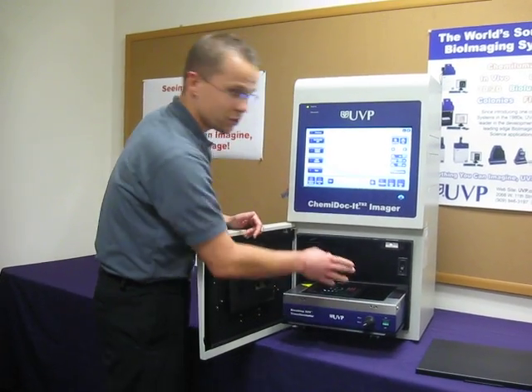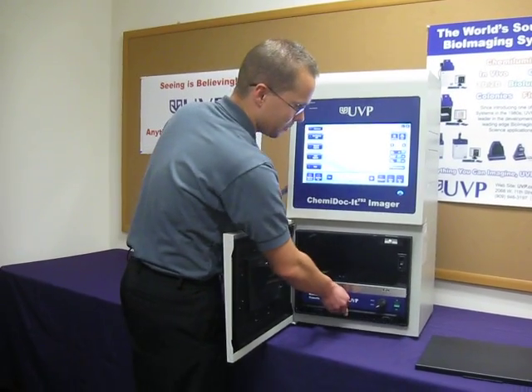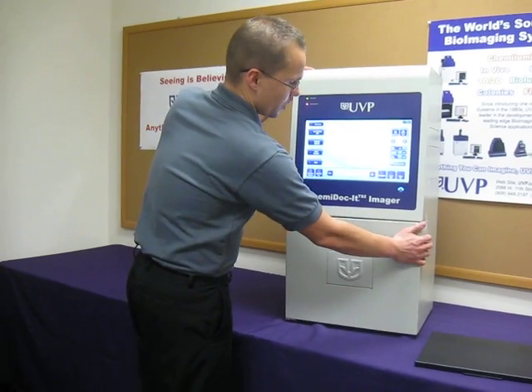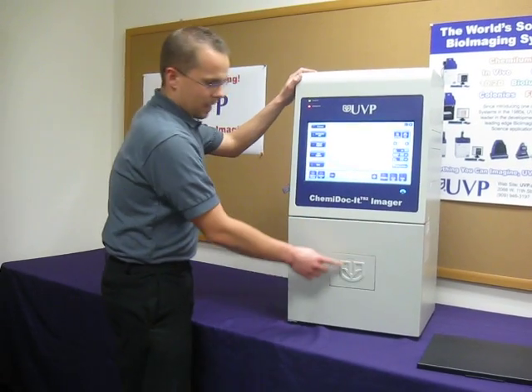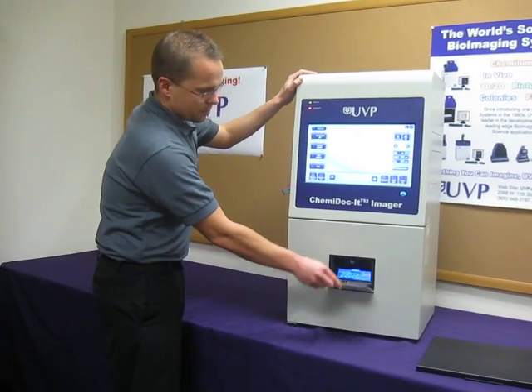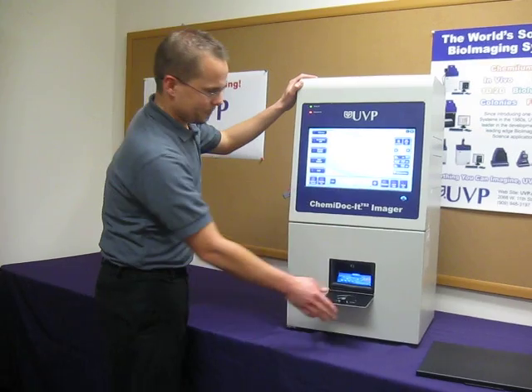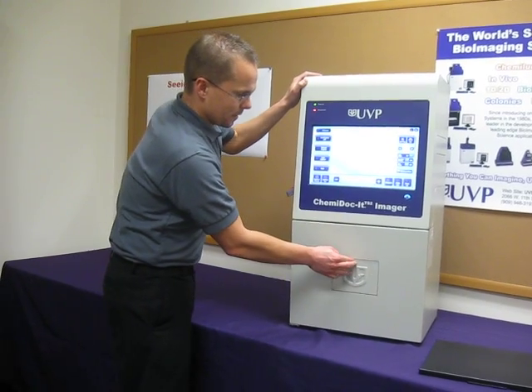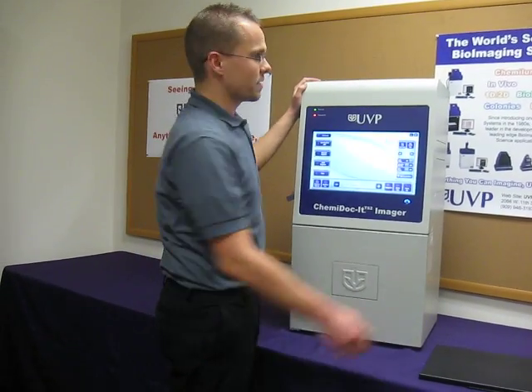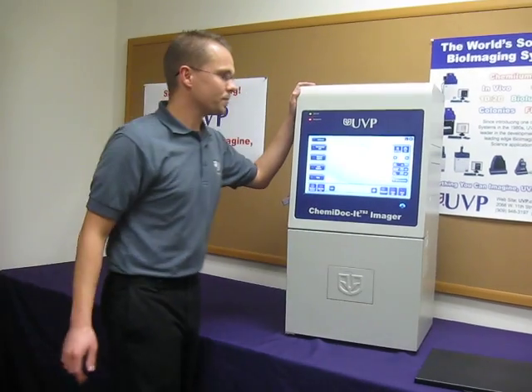Once you've placed your sample, simply roll in the transilluminator, close the dark room door, and then you can open the UV viewer window to see directly inside the dark room.